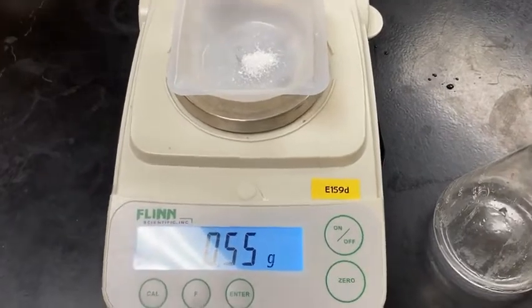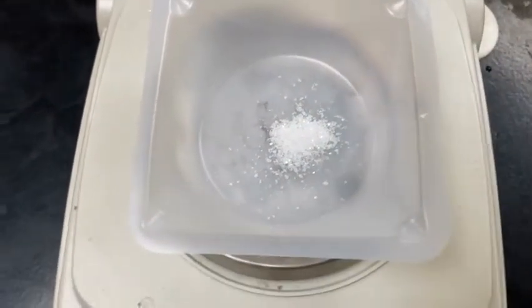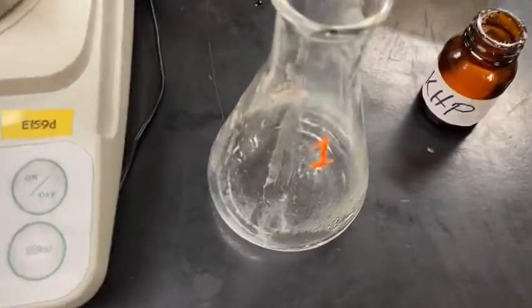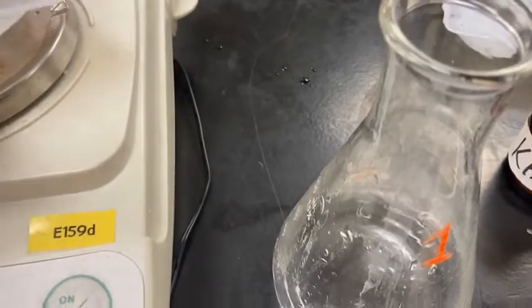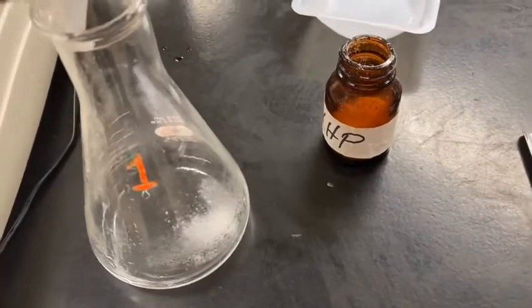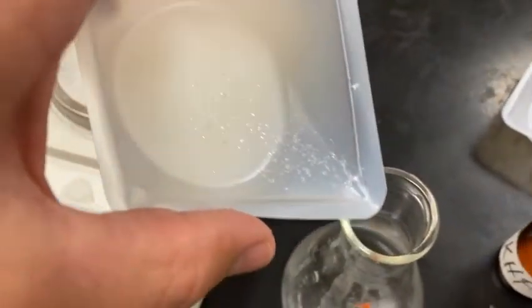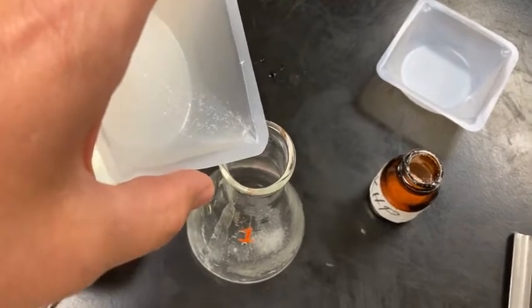So the next part of the lab, I am going to take the KHP. It's a nice white crystalline. This has been sitting in the class oven. I just took it out and measured that amount, and I'm going to be adding it to sample 1. I marked the Erlenmeyer flask number 1. That represents this sample. I'm going to be putting that KHP down into the flask. I want to make sure I get it all in there. One of the techniques I'm going to use is to take my water bottle and spritz the inside of this to make sure all that KHP gets transferred down into the flask. And then when you come back, I'll have sample 2 weighed out so you can collect that data.